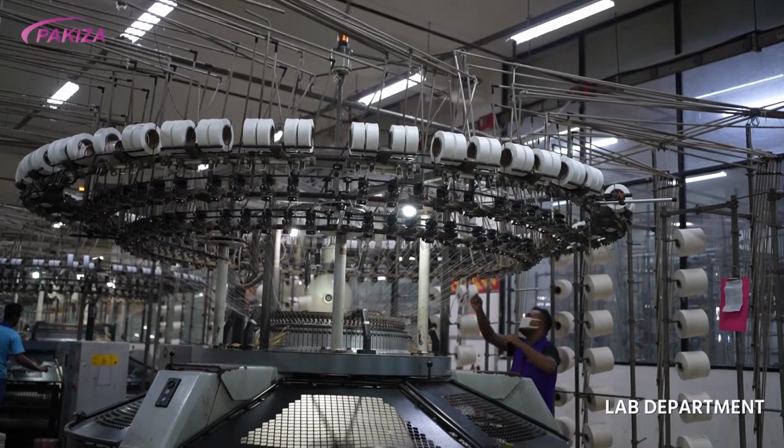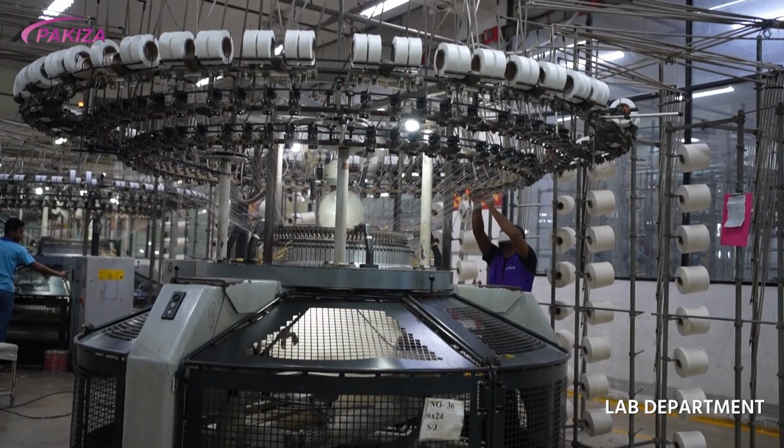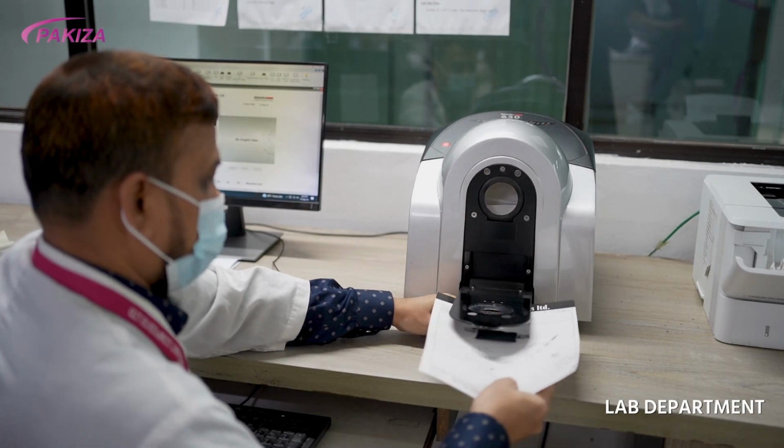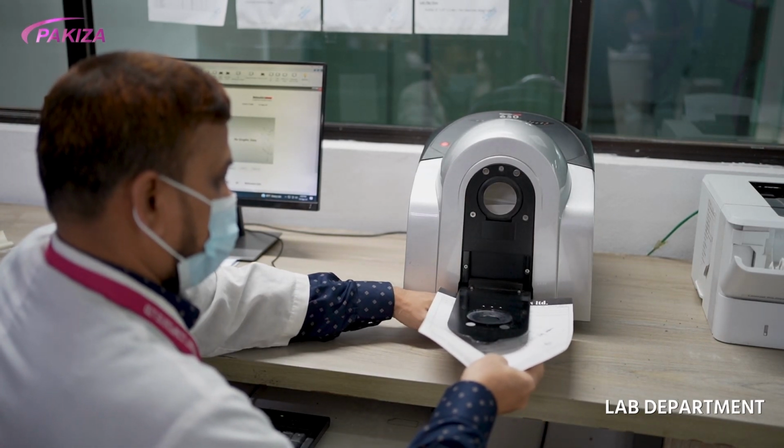Then a sample fabric is knitted in the knitting machine. Using spectrophotometer, we find out the dyeing recipe required to achieve the desired shade of the fabric.